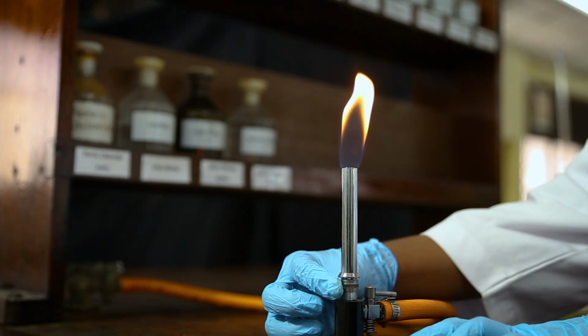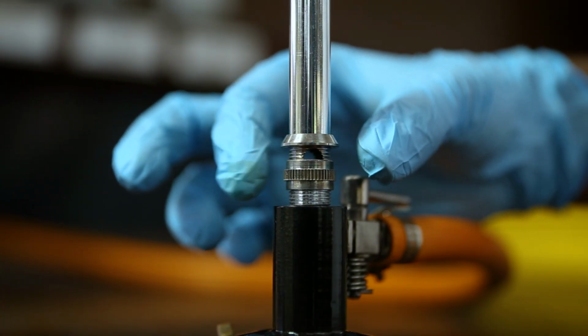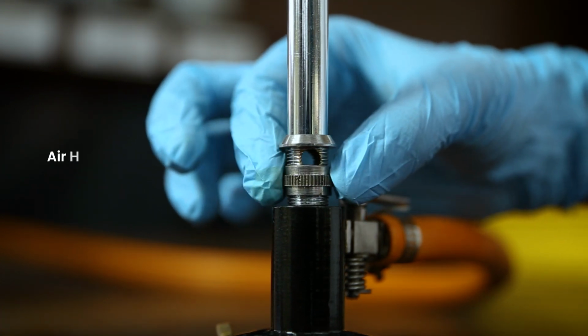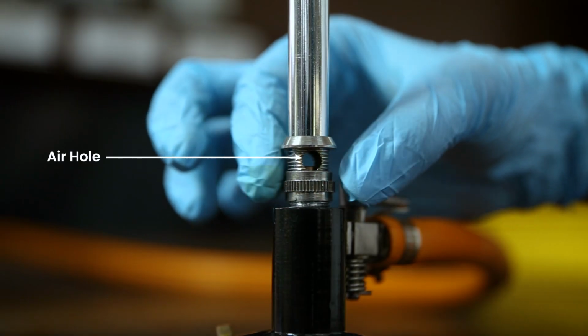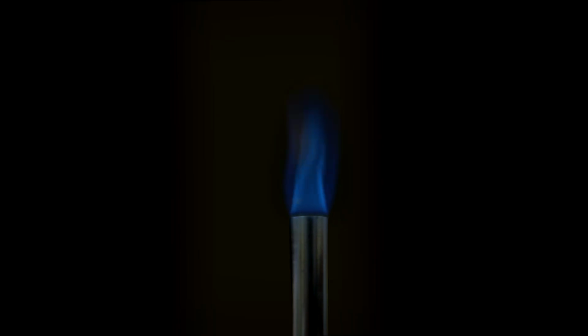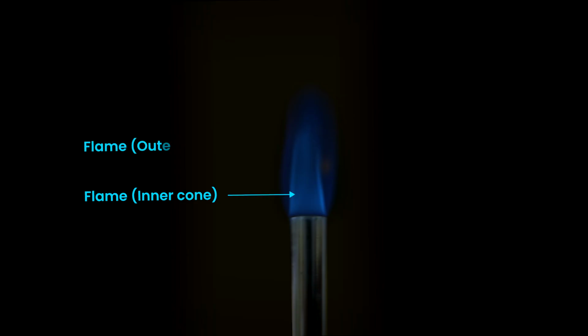To make a blue flame, you will turn the barrel by opening the air hole. Do this by holding it at the base. If you get the blue flame at the first point, you should not worry about that step. Now, you change the color of the flame from yellow-orange to blue. You will also want to make sure not to let too much air in because this can blow out your flame. You will know that your flame is ready to use when it is dark blue with a darker inner core. The blue flame on a Bunsen burner generates the hottest flame. You completed the first step of lighting the Bunsen burner.